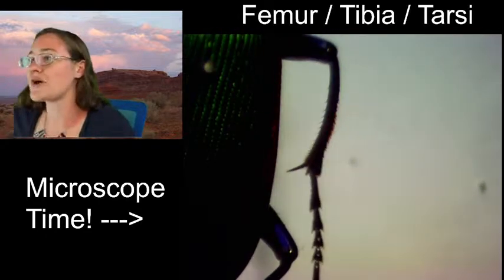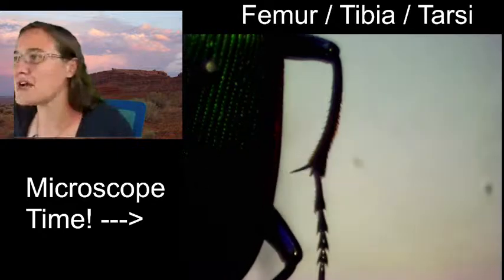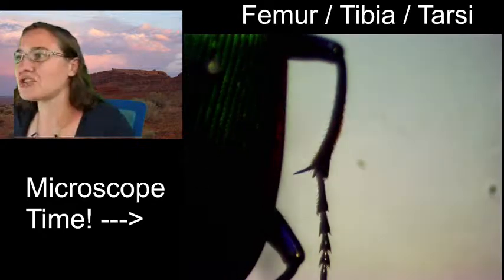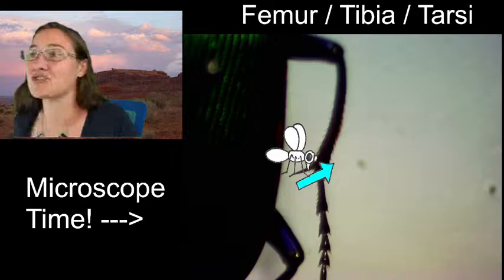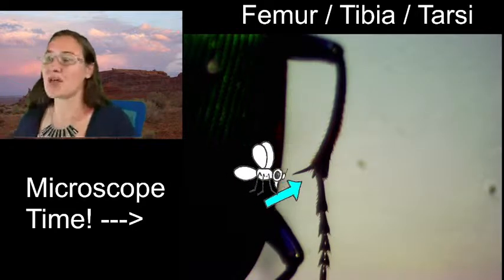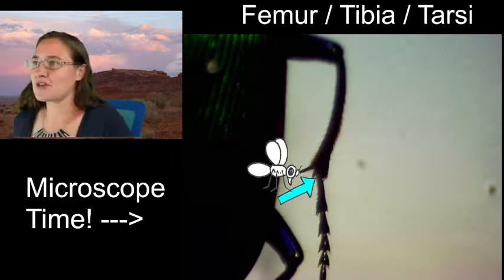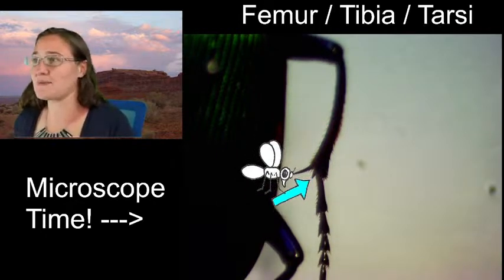So on the middle leg, we can see the tibial spurs a little bit better. If you're looking along the inside, you can see this tibial spur right here, and then this little itty bitty one right there. It's the same length, it's just at a different angle. So we've got femur, tibia, tibial spines, or we can call them tibial spurs.